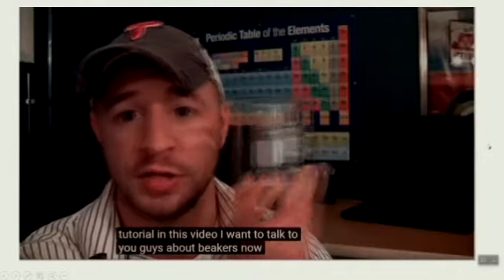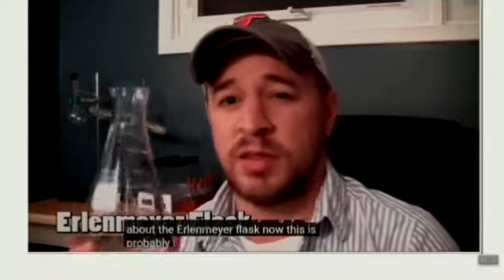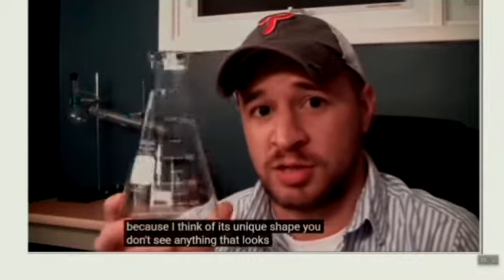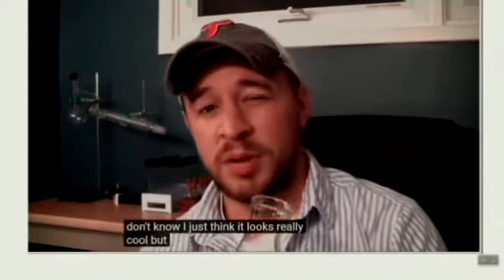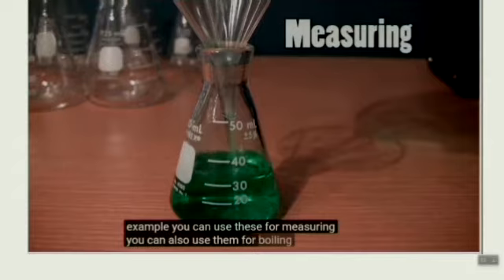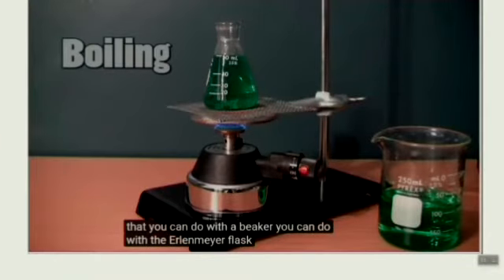How about the Erlenmeyer flask? I want to talk to you guys about the Erlenmeyer flask. This is probably the most famous or popular piece of chemistry glassware, and that's because of its unique shape. You don't see anything that looks like this other than in a chemistry lab, and I just think it looks really cool. But the uses of these things are actually really similar to beakers. For example, you can use these for measuring, you can also use them for boiling solutions, etc. Basically anything that you can do with a beaker, you can do with an Erlenmeyer flask.